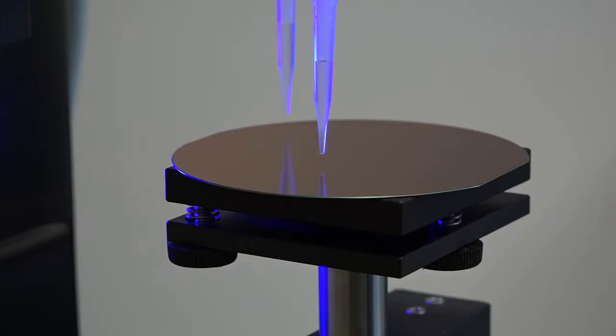Here you can see how the droplet is created using the first dispenser, then automatically being placed on the sample surface.